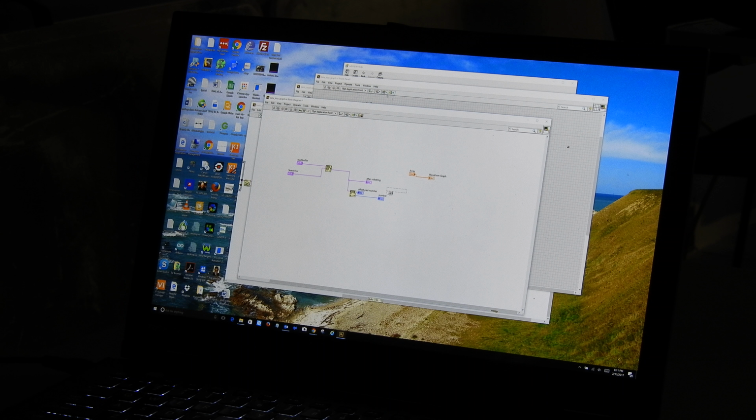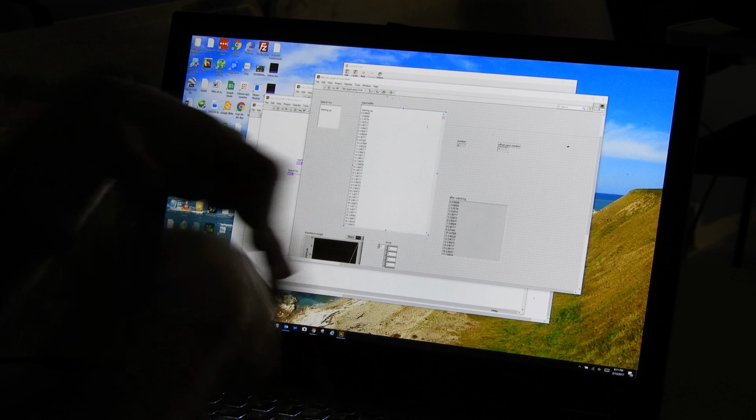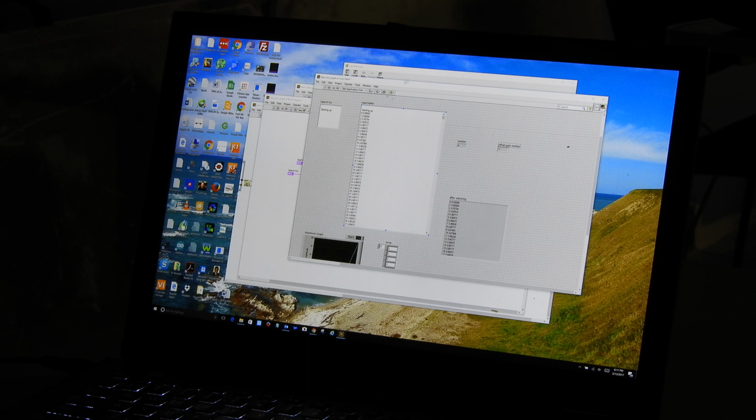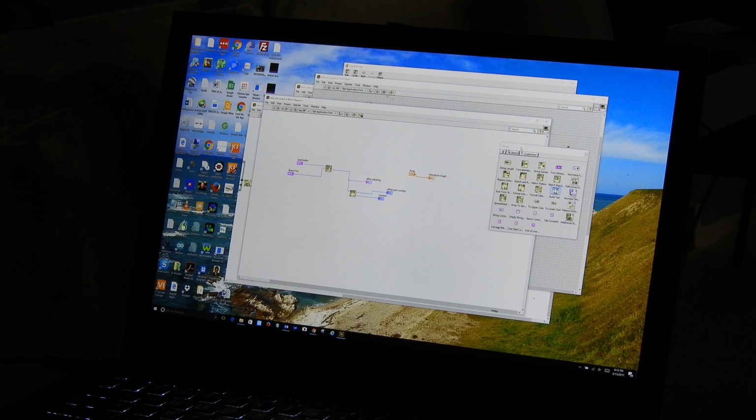Now I want to take that first number, and I want to turn it into an actual floating point number. And so I would do that by picking another one of these string functions. I'll go over here to string. I'm going to go ahead and plop this down because I'm going to need it. And we're going to go number conversion, and we're going to say fractional. Yeah, we're going to take a fractional.